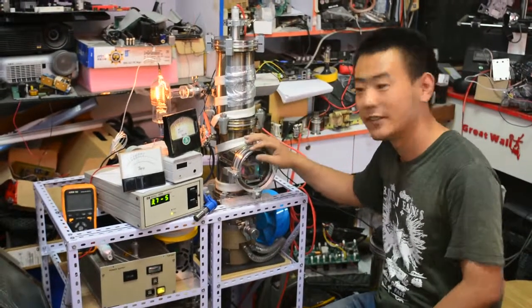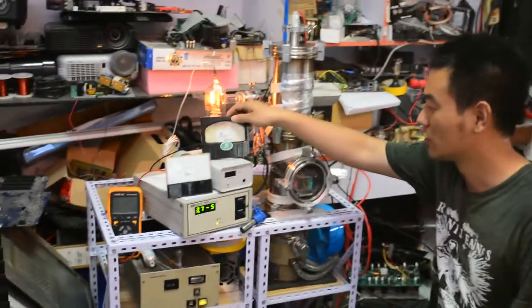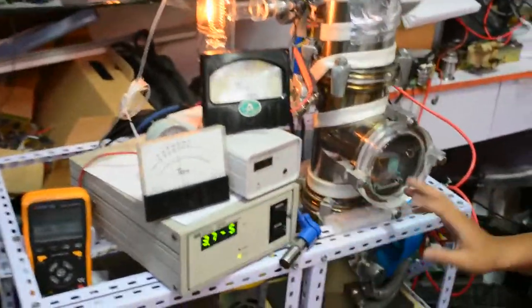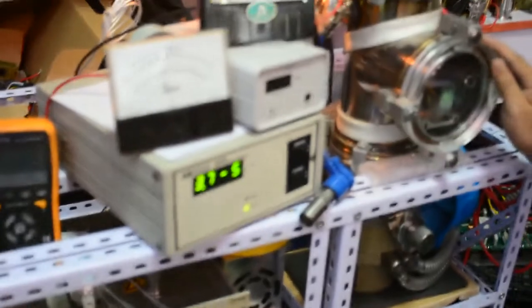Hello everyone. In this episode, I will show you the vacuum gauge operation and the basic vacuum system vacuum level.